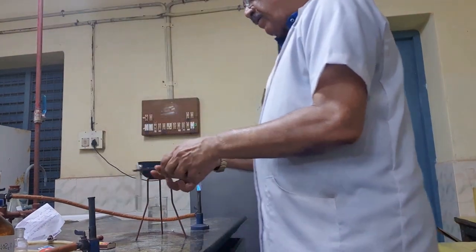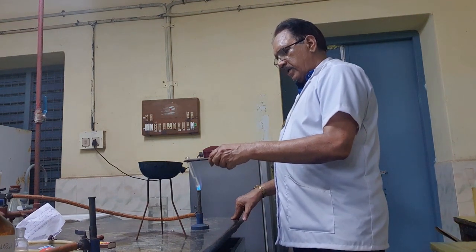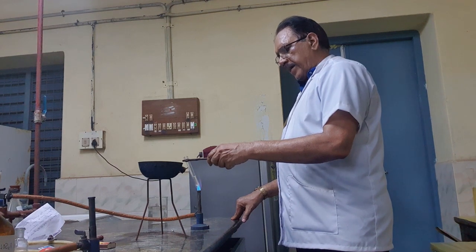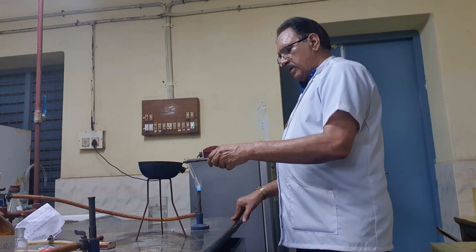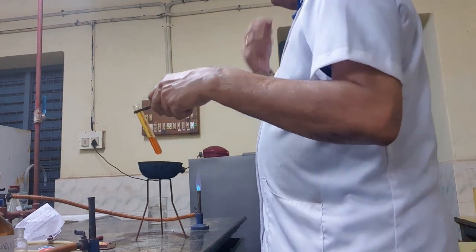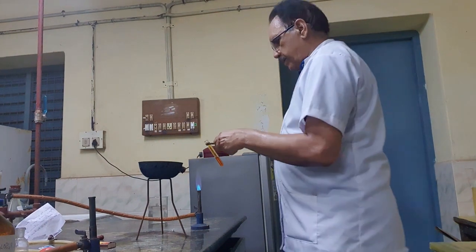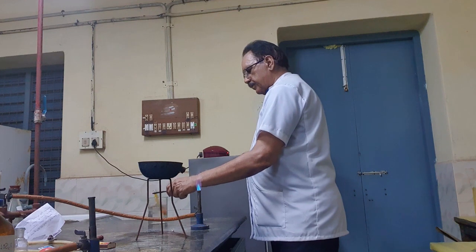Now I am heating for complete reaction. See, after heating, what do we have to do now? Then we have to cool it.